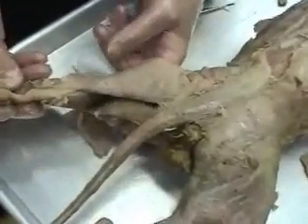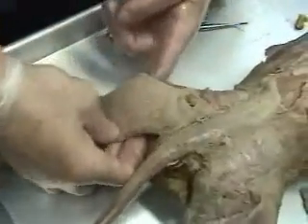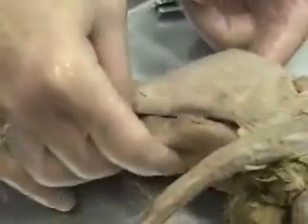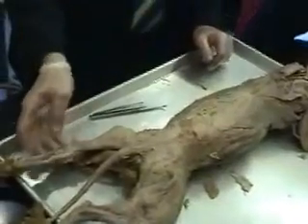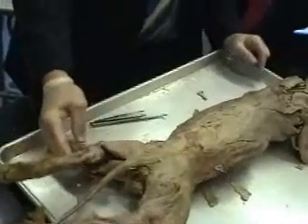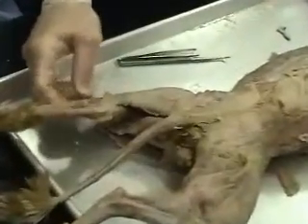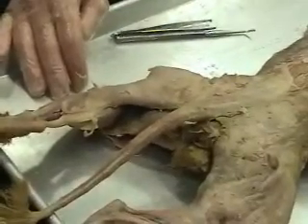They are the posterior flexor muscles that flex the lower leg. The three hamstrings: on the lateral side is this huge biceps femoris, right next to it a narrow semitendinosus, and then there's a medial semimembranosus. These muscles originate on the ischial tuberosities at the bottom of the pelvis, they insert on the back of the tibia, they pull the lower leg — they flex it, pulling it up towards the butt. The ischial tuberosities causing flexion of the lower leg. This group are the antagonists of the quadriceps femoris, which extends the lower leg.